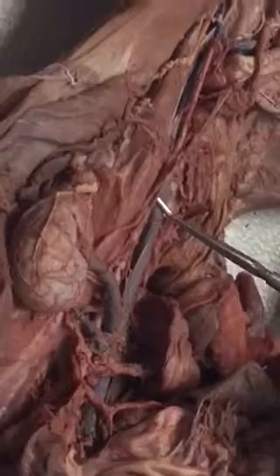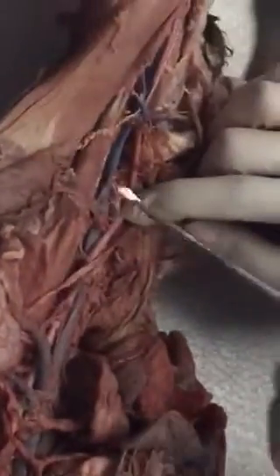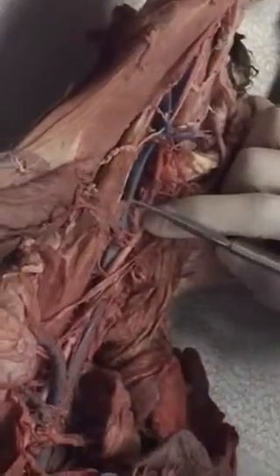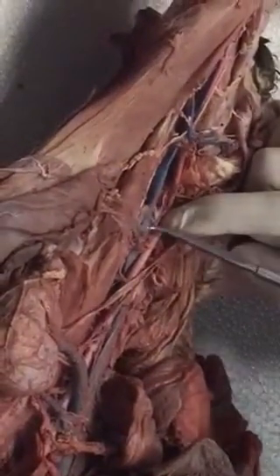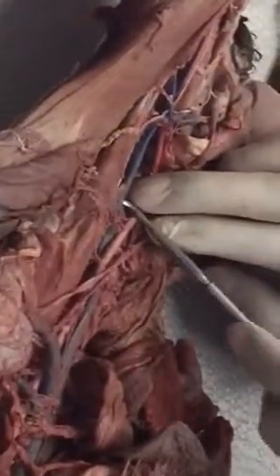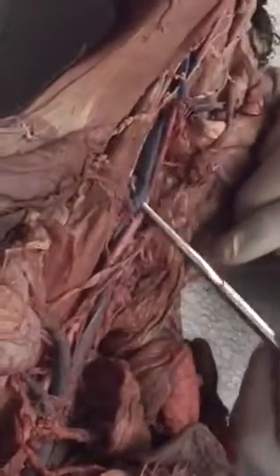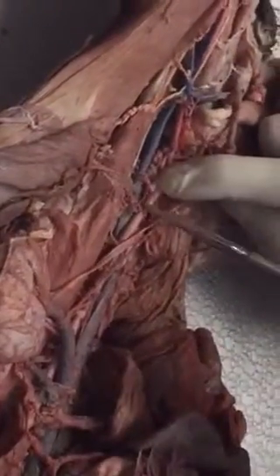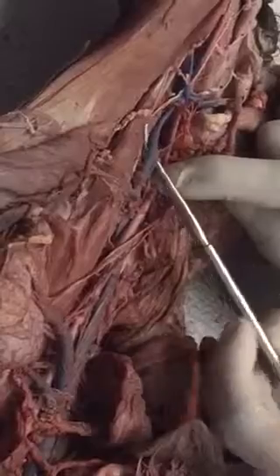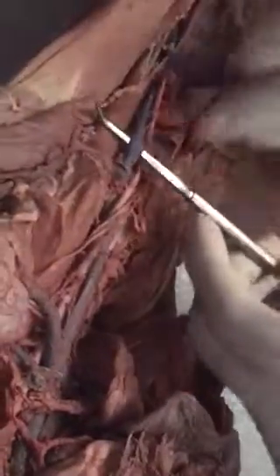Going down further, you get to your, oh yeah, there's nothing there. So then you get to the split where the part where it splits right here, and it stops being your inferior vena cava, and it goes to your iliacs. You have your left iliac right here, and your right iliac over here. I'm sorry, I forgot to say common. Left common iliac and right common iliac.